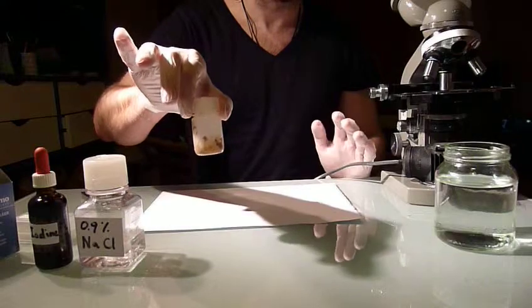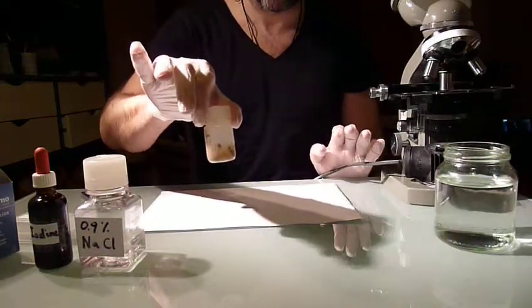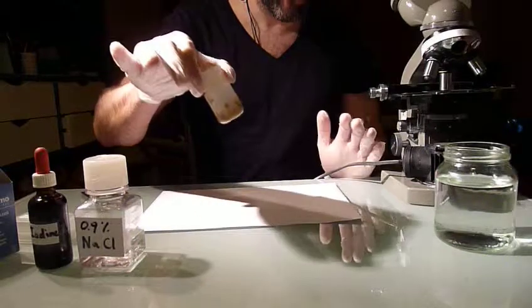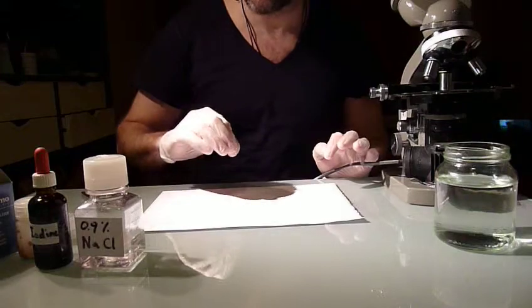If we're going to look for cysts, you can detect them for quite a long time. So fairly fresh, less than a day old, let's put it that way.